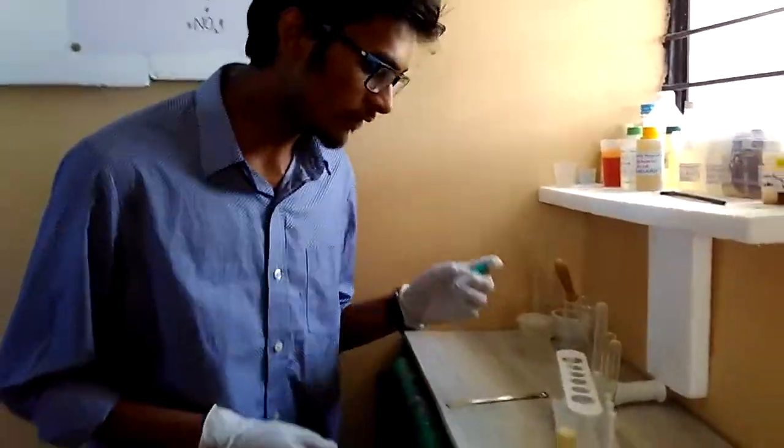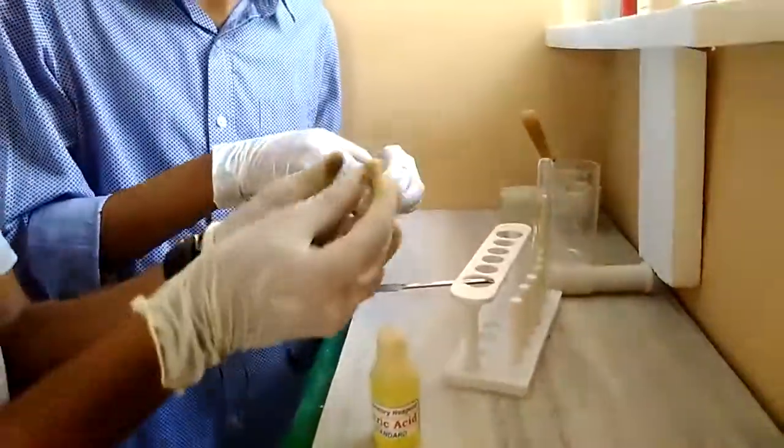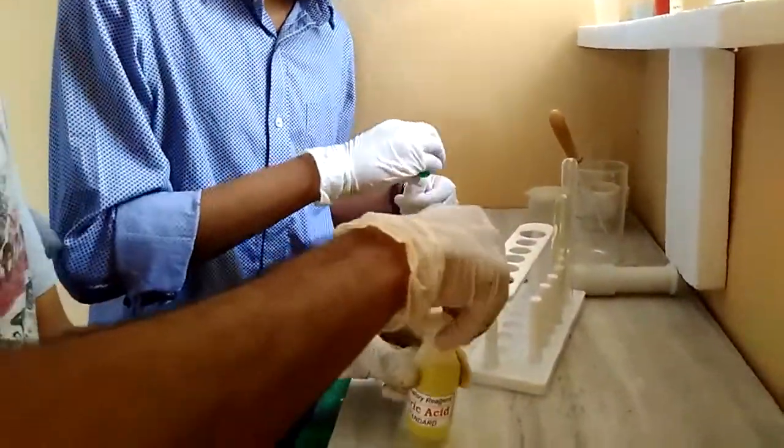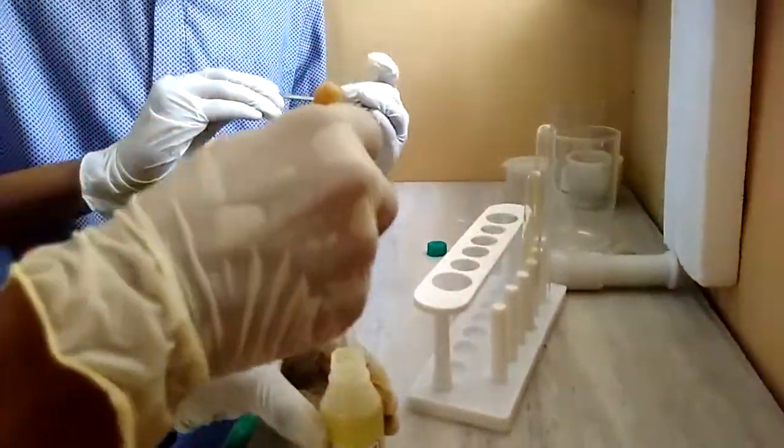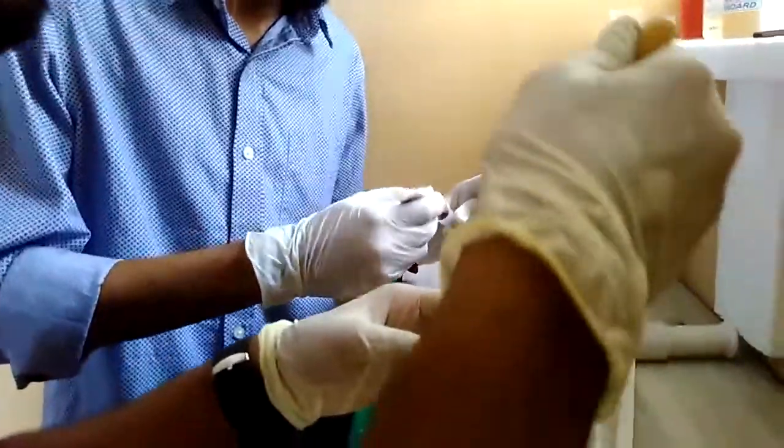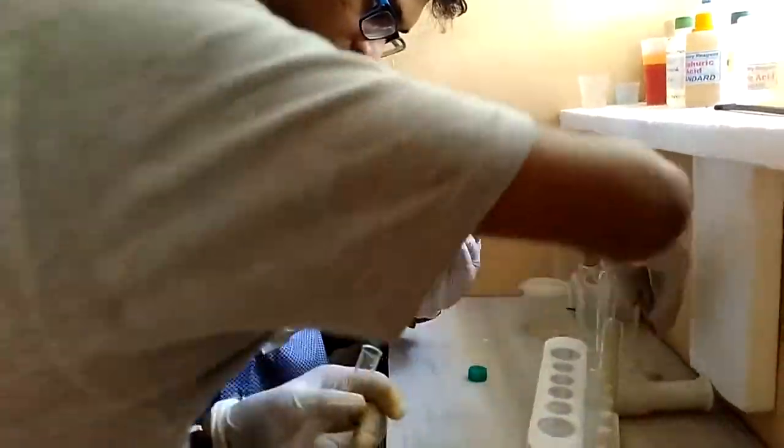So here I have copper with me and this is nitric acid. And Adin can pour some nitric acid for now. I will take some nitric acid into this beaker with the help of a dropper. Yeah, I have enough nitric acid.